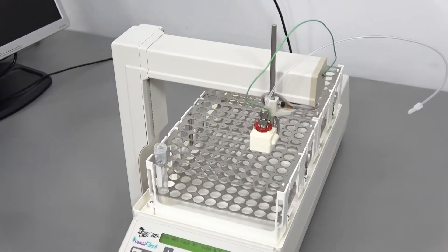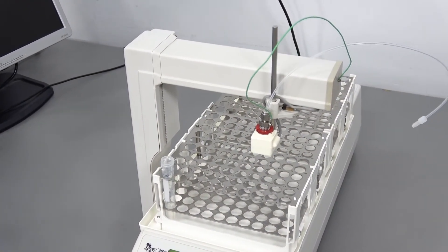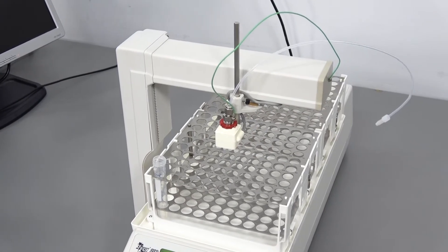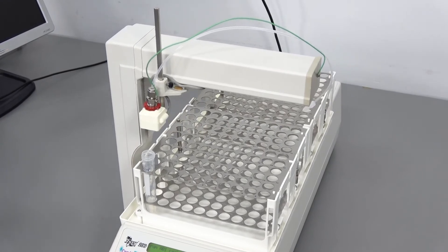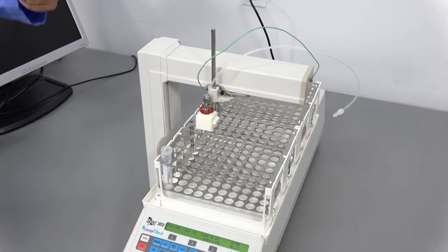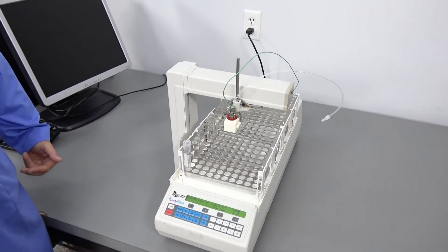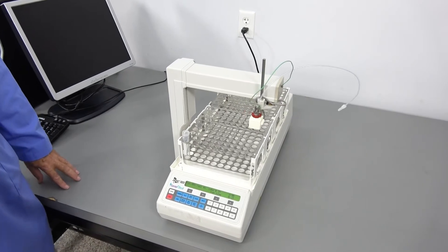Here's where it would be halting in between each one of the tubes if you had it set for count drops. So you could tell it that you want to collect 10 drops in each or that you want 10 milliliters in each. This would be assuming that there's a flow that it's accepting.